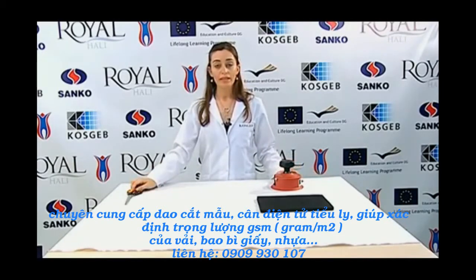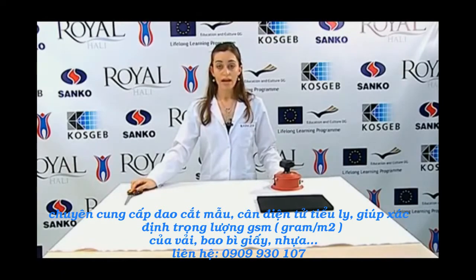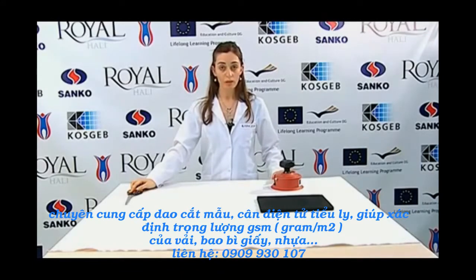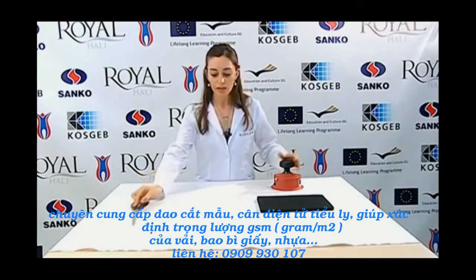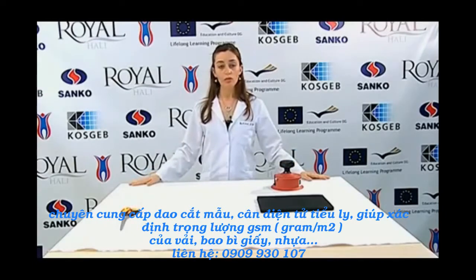The first thing to do when preparing the sample is to condition the sample under the standard atmospheric conditions for at least 24 hours. If the sample contains a wide pattern and the value affects the mass per unit, a number of samples to contain the whole pattern should be taken. Normally, the number of samples taken is 5 for the experiment. Primarily, the sample is laid on a flat surface.